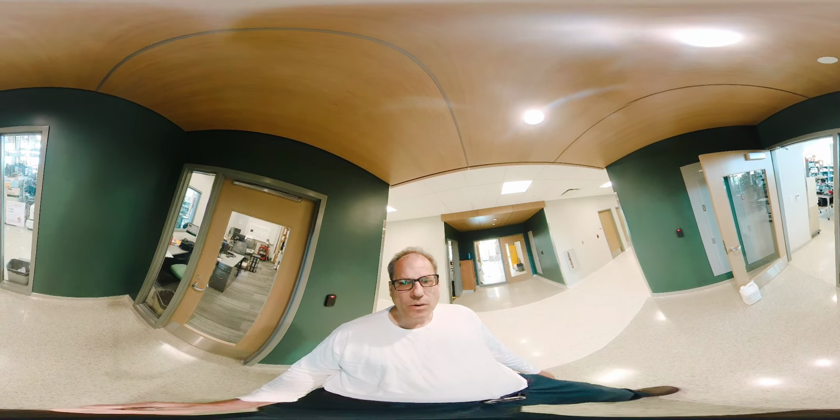Now we have 3 of these vacuum systems. That's another one that is half taken apart at the moment. That one we use for kinetics experiments, and that's perhaps also something you remember from a PChem class, even from high school. So we're looking at reaction rates when studying surface reactions. Also that is a vacuum chamber. It is wrapped in aluminum foil for cleaning the chamber by itself.